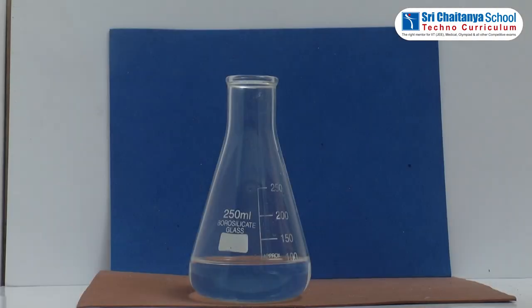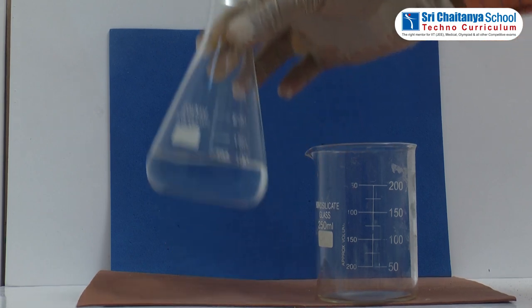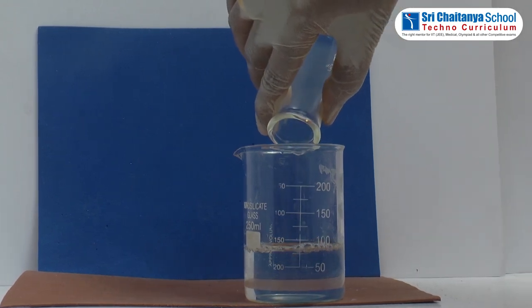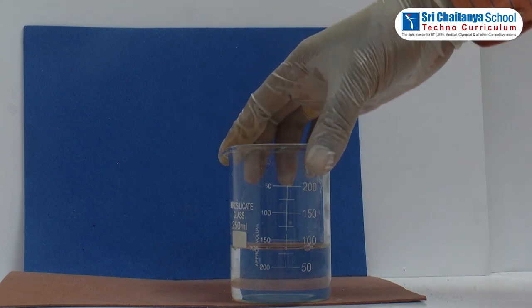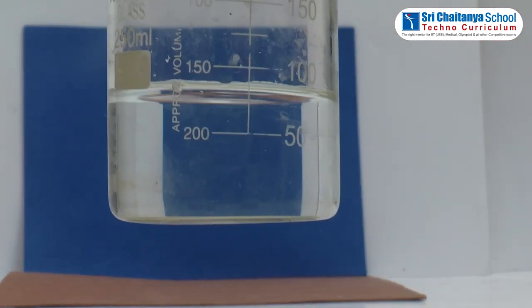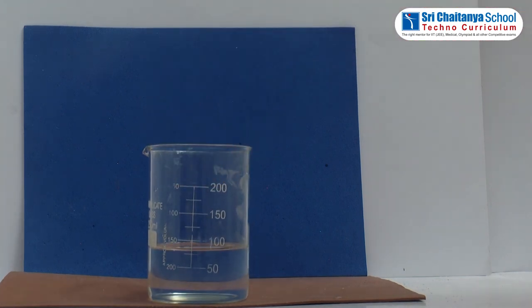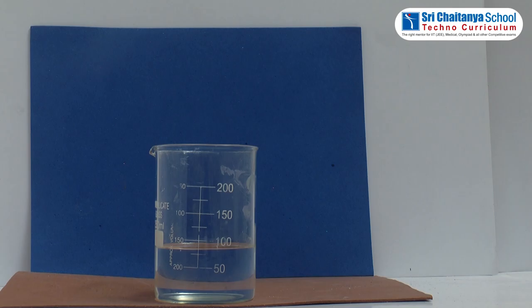Now pour some water into another container and have a look at the shape. Repeat the process till you complete pouring of water in all containers.